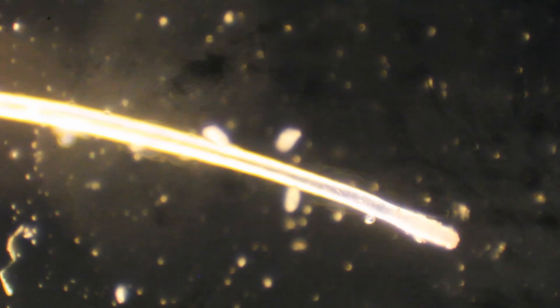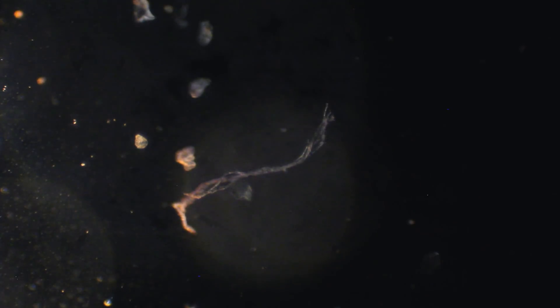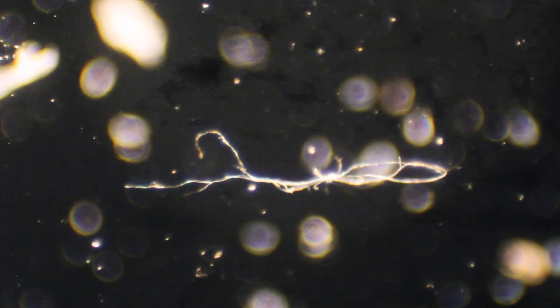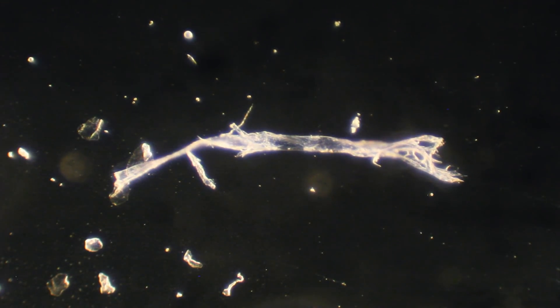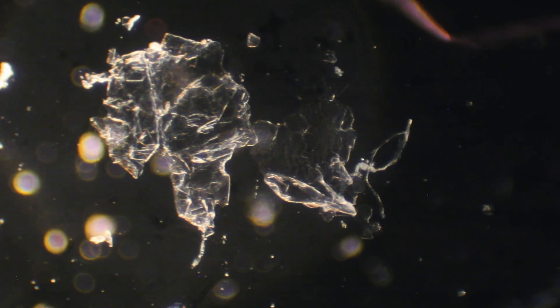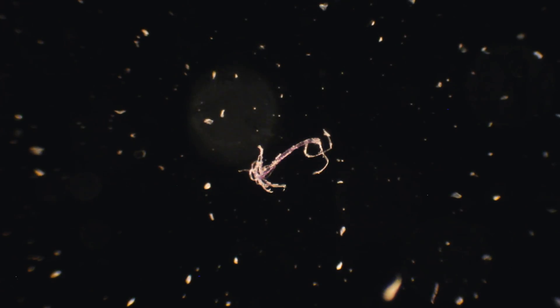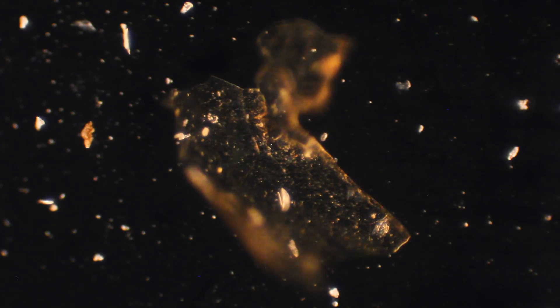Here, everything is mysterious in its nature. You can see the dust as is, yet it doesn't mean you know what it is made from. Everything looks like it is hanging in space, frozen, like a deep-water fish. The dust appears very alien when you look at it with the dark-field condenser. Even though this is an alien world, the more I look at it, the more it becomes familiar and personal.